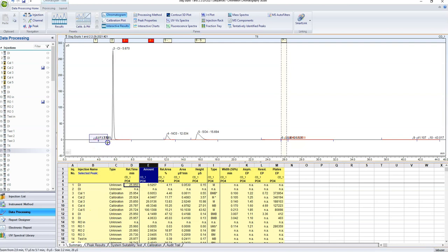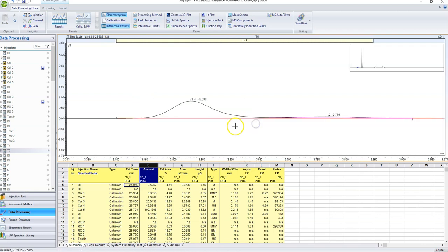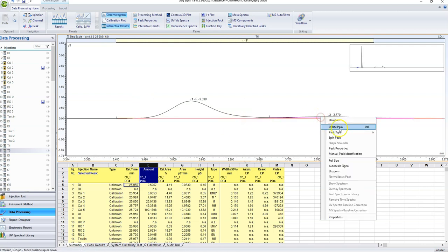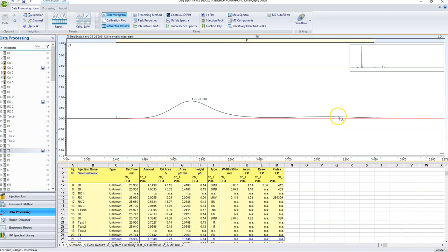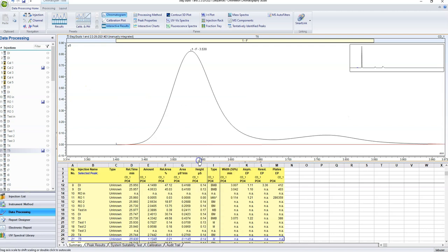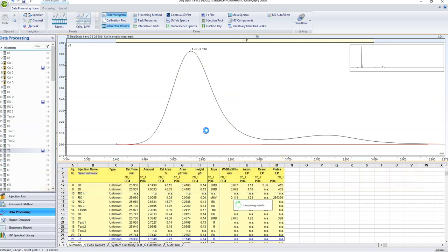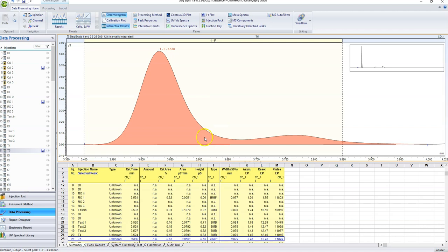Like I said earlier, by far the most useful tool is deleting peaks and making new peaks. So that's not a peak right there. I don't want it. That was just a flat line. I don't want that there, so I deleted it. And my fluoride peak, right? Auto scale signal. Here's another thing. Auto scaling. You see how this is probably some sort of organic material. They usually come off right around fluoride, organic acids. And we don't want that involved in our peaks.